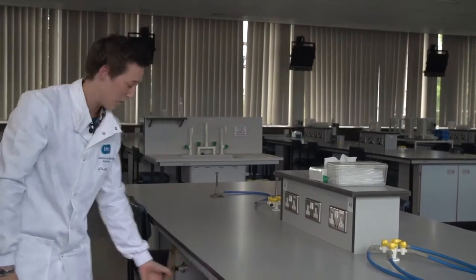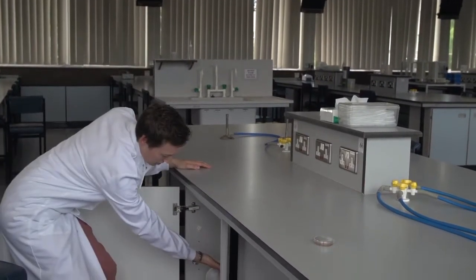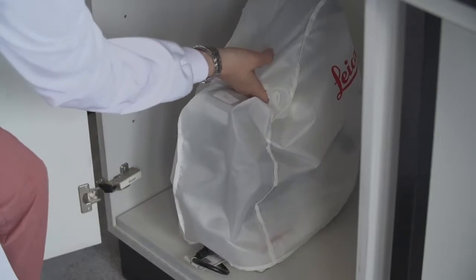So first we start by getting them out of the cupboards. Now these stereo microscopes have got a nice handle just at the top of them, so just pop your fingers under there and gently pull it out of the cupboard.